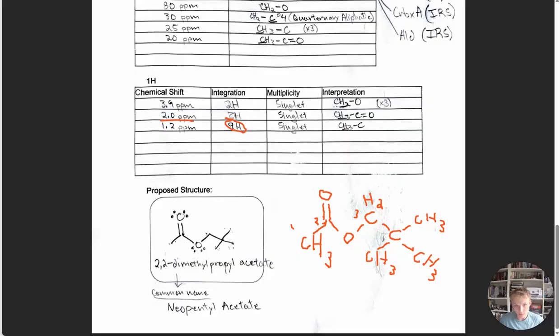All right, and so the 25 ppm value shows a really strong peak. And we can leave the 20 for this methyl group because this 25 ppm has a really tall, strong peak, which indicates that our methyls are multiple or equivalent. That's what that tall peak tells us. So that fits with the 3 carbons on the methyl groups attached to the quaternary carbon. And then lastly, we have the quaternary carbon itself, and this is going to get a high ppm value because it has only C to C bonds. And so this is going to further shift it downfield.